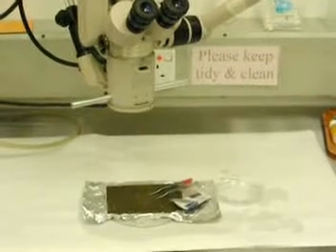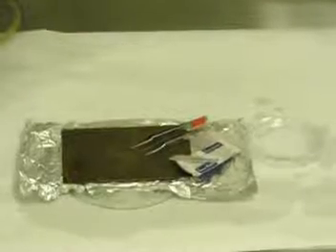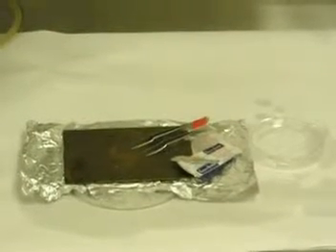We are going to dissect the brain under a microscope. The dissection tools are kept ice cold. After rinsing with ice cold DEPC water, we put a brain onto the ice cold metal plate and halve it into two equal hemispheres.